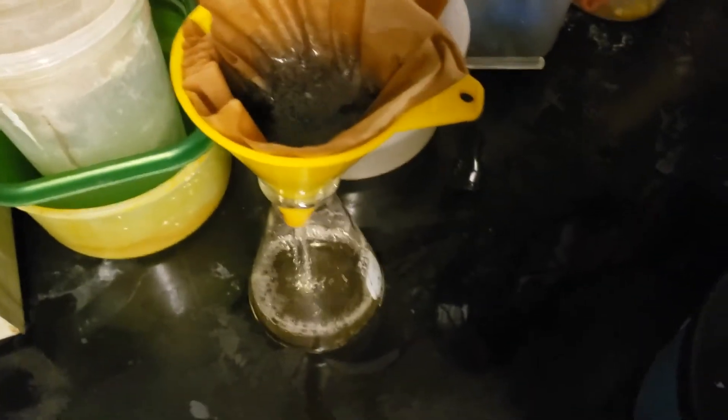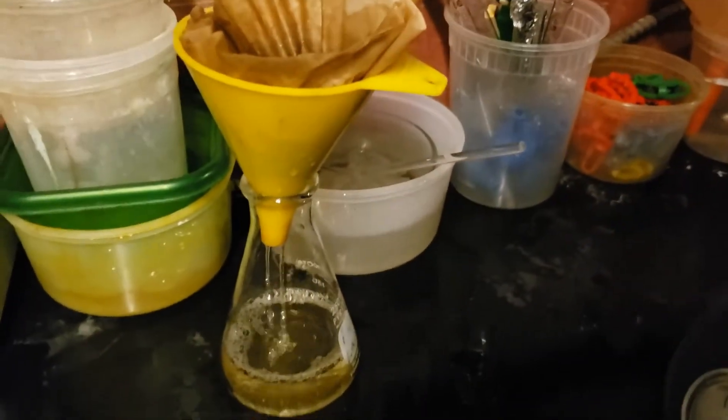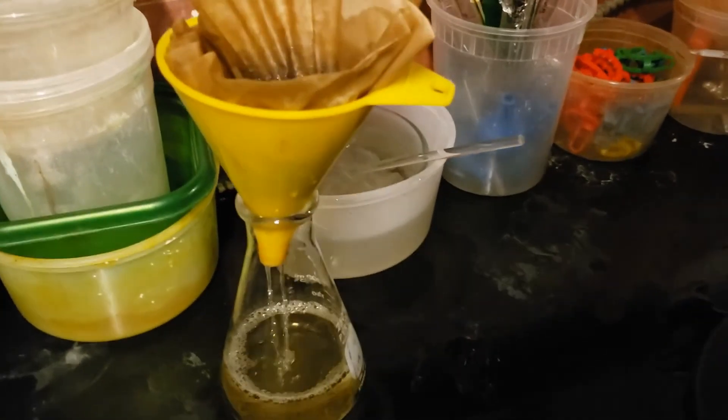Another gravity filtration is carried out to remove any impurities as well as activated charcoal. A little boiling water was used to wash the small amount of benzimidazole that crystallized out.